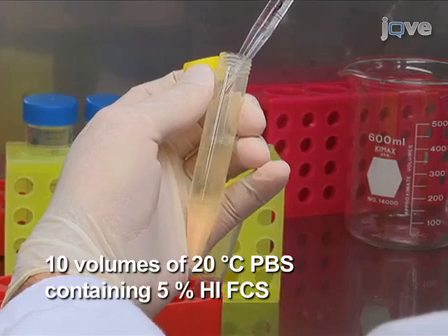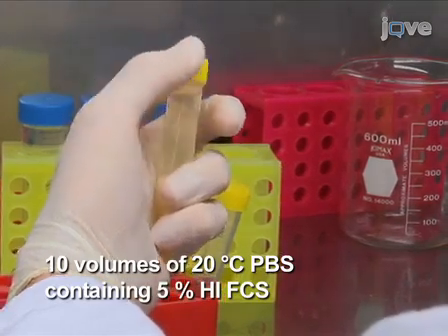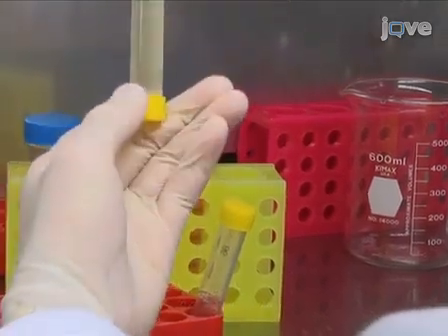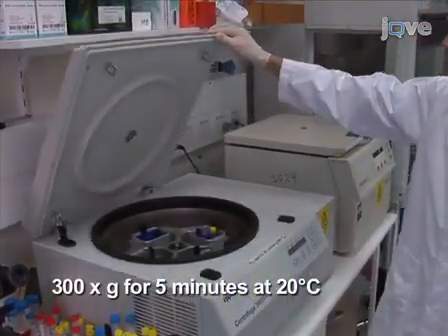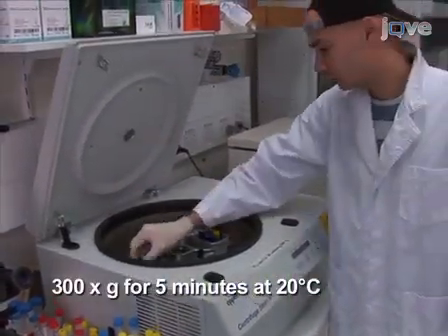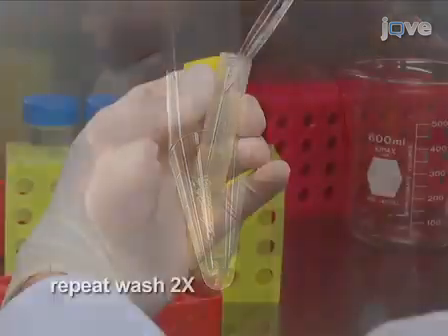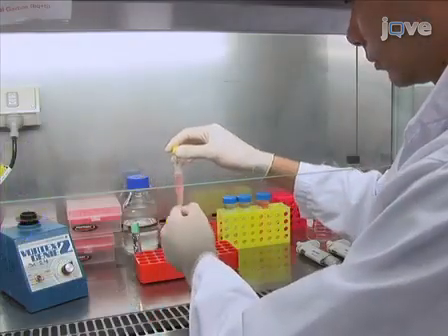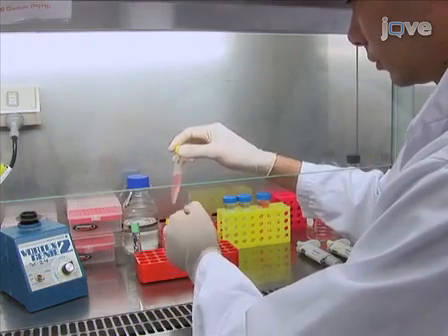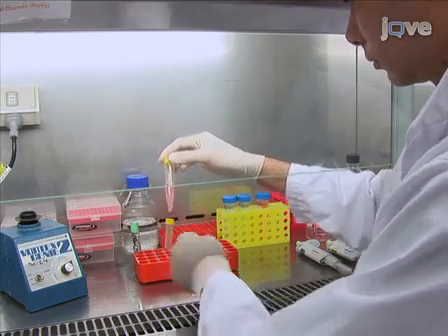Wash cells by diluting in 10 volumes of 20 degrees Celsius PBS containing 5% HIFCS, sedimenting by centrifugation at 300 Gs for 5 minutes at 20 degrees Celsius, and discarding the supernatant. Repeat the wash twice more. Cells can then be applied to a protocol of interest for induction of cell division. Labeled cells can be used in both in vitro and in vivo assays.